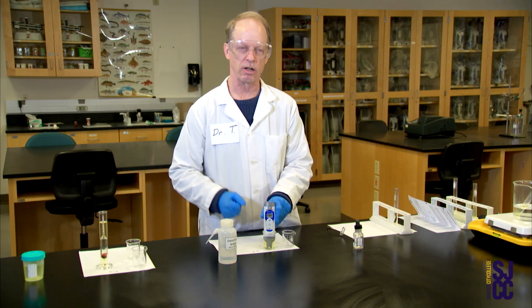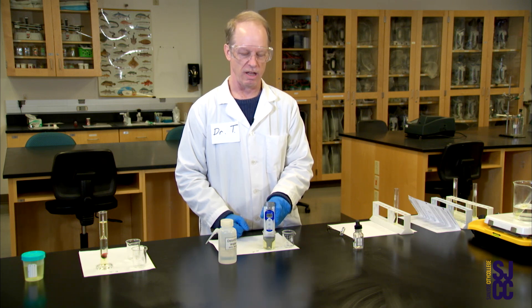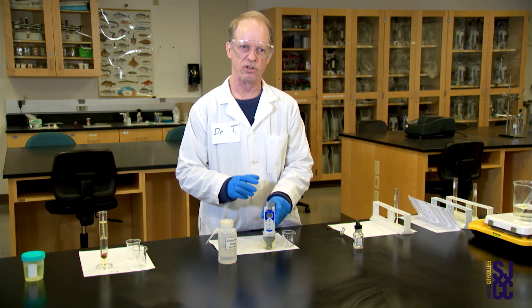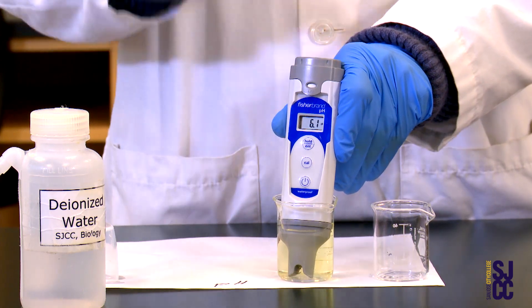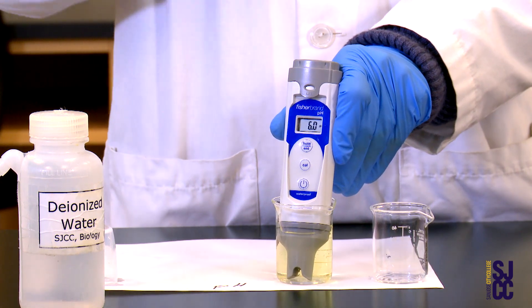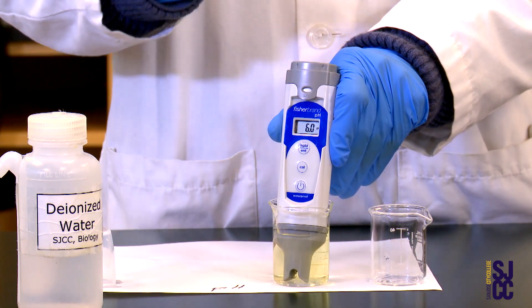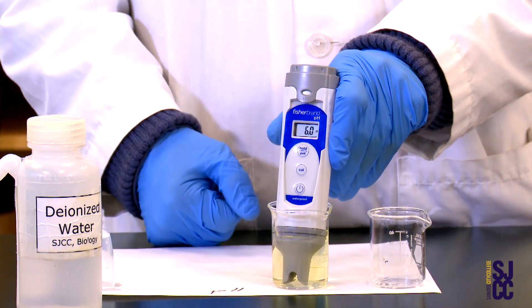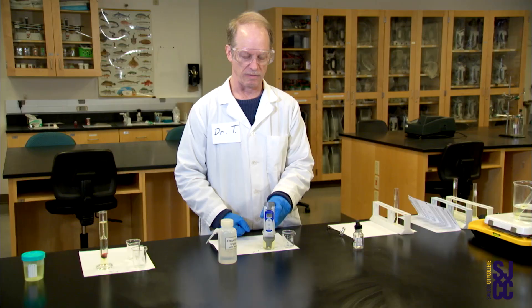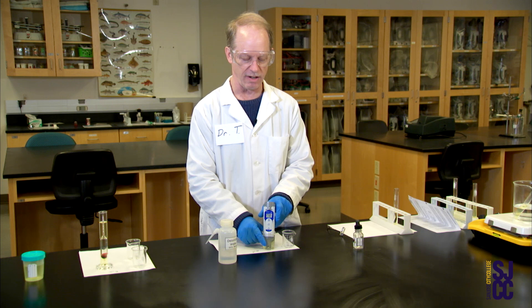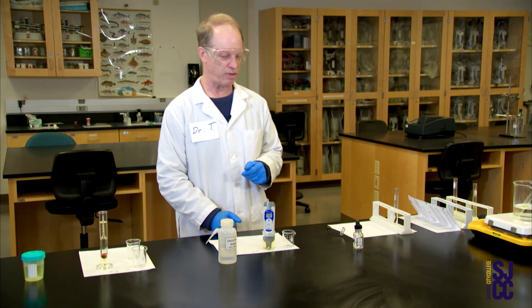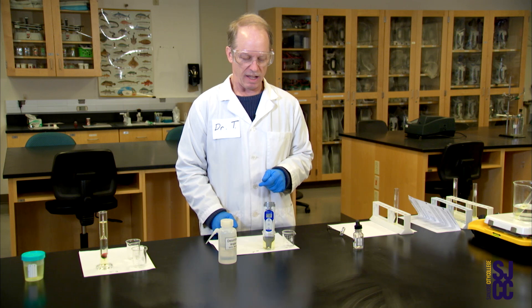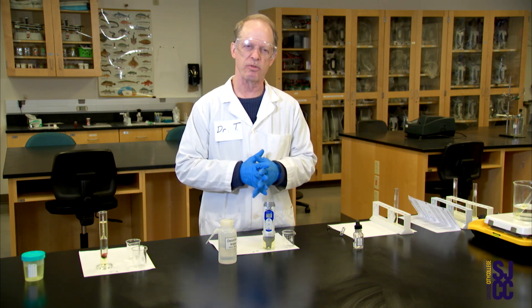Then you wait and you wait and you wait patiently, as if you were sitting through a long commercial break on Discovery Channel. The idea is the numbers are supposed to change and they're supposed to stabilize. This doesn't have a big light that comes on when it's done so you just have to wait until it stabilizes and it stops changing. That's your pH value. I'm just going to let this sit there so I don't get a finger cramp like Sheldon Cooper or somebody might get.